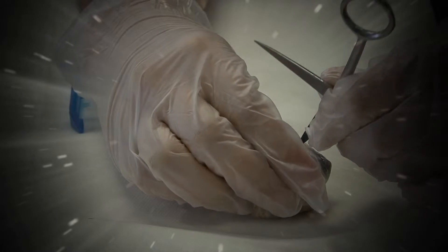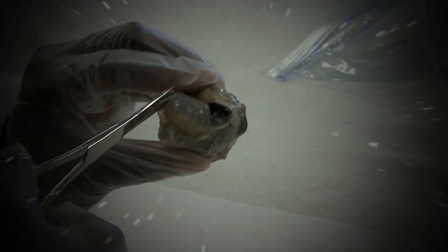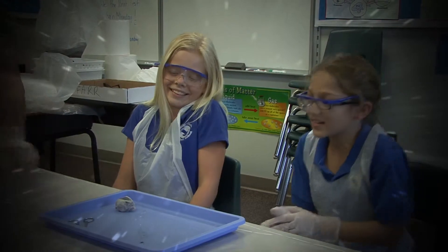So you guys have the cornea off? If you lift up or remove the cornea and look inside, you can see — we're pouring out that liquid — that's called aqueous humor. Aqueous meaning watery.